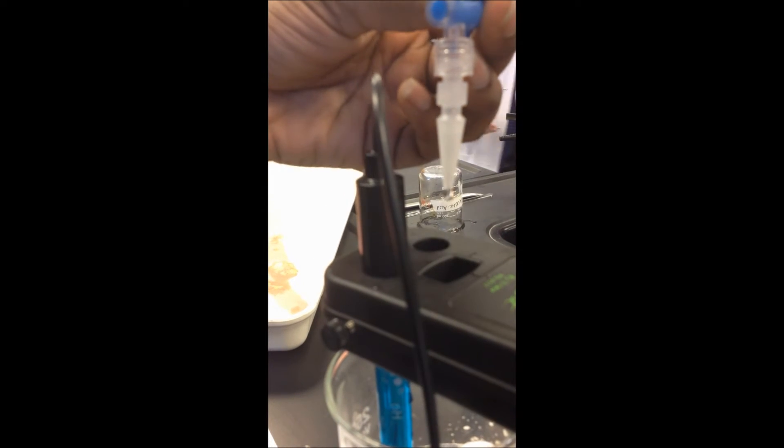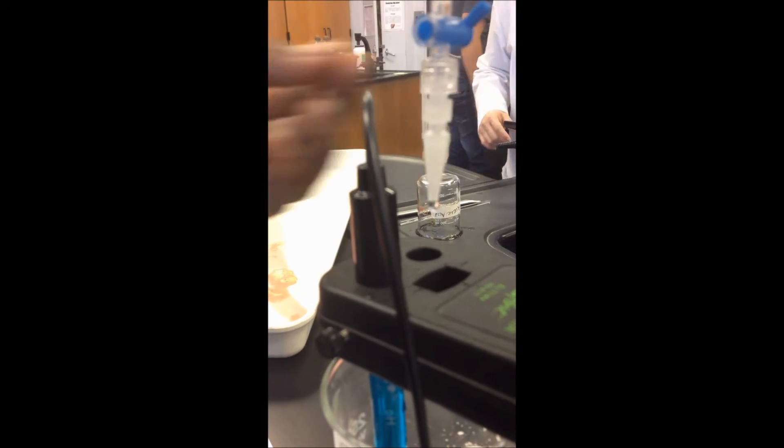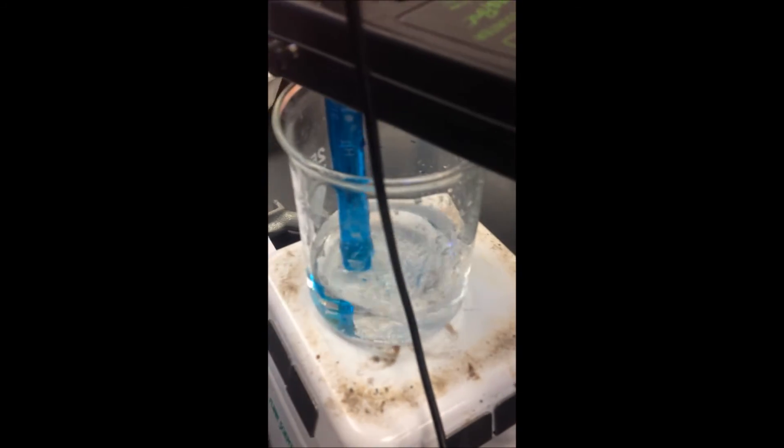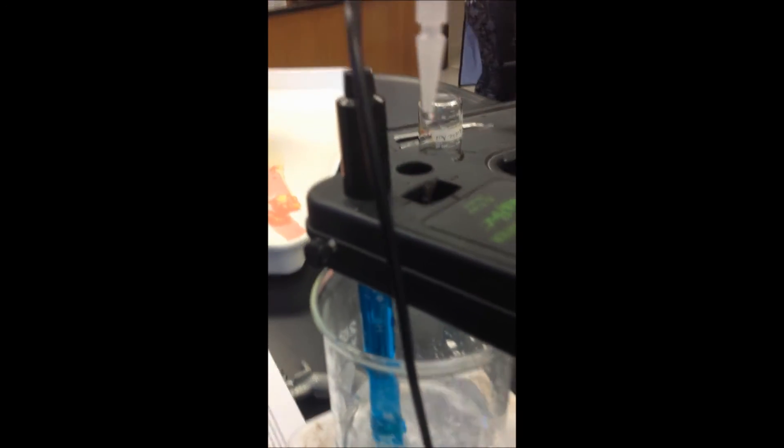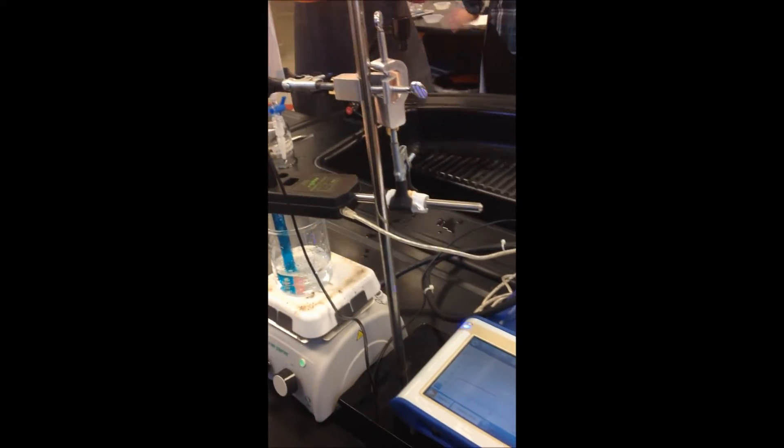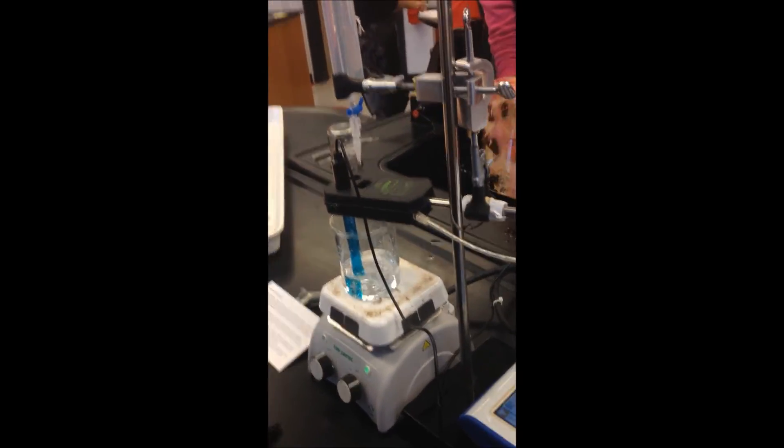The pH just went to 4. Slow it down a bit. You see, it's buffering.